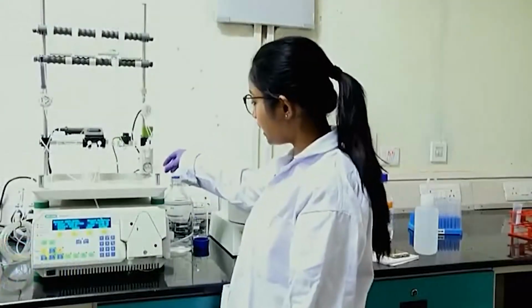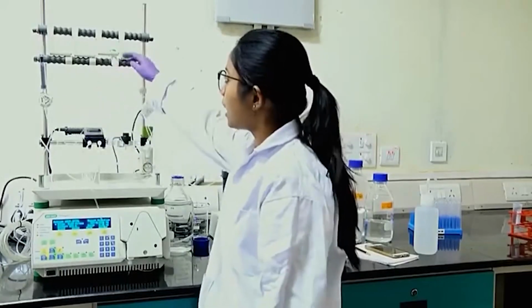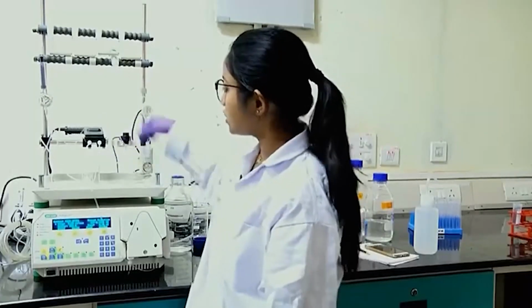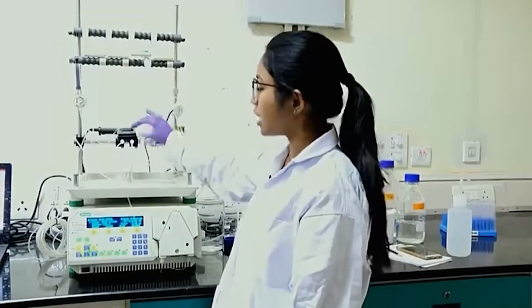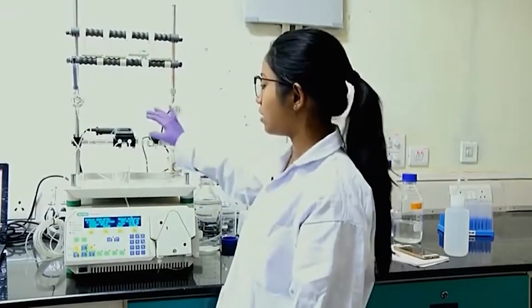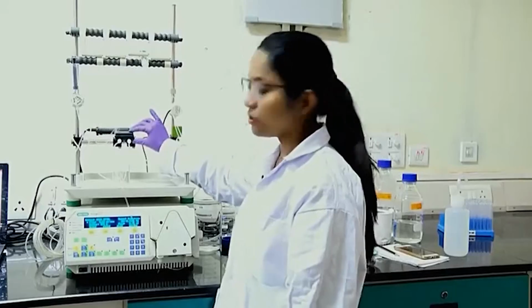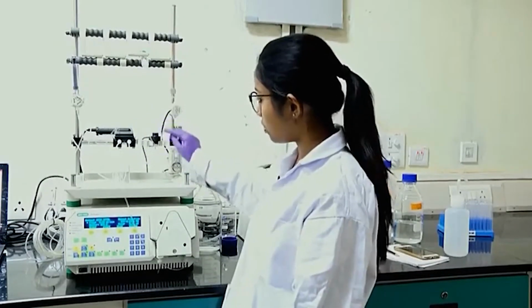So, from this inlet, it will take up some amount of water, pass through all this tubing and then go through this column. From the column there is an outlet tube, and it will go to this UV lamp. This black box has the UV lamp, and it will measure the absorbance at 280 nanometer. Because we are working with protein, and this is a machine for protein chromatography, we have the UV lamp set at 280 nanometer, because protein absorbs at 280 nanometer. It will take the measurement of the flow through at 280 nanometer, and then it will go out and go to this small black holder.